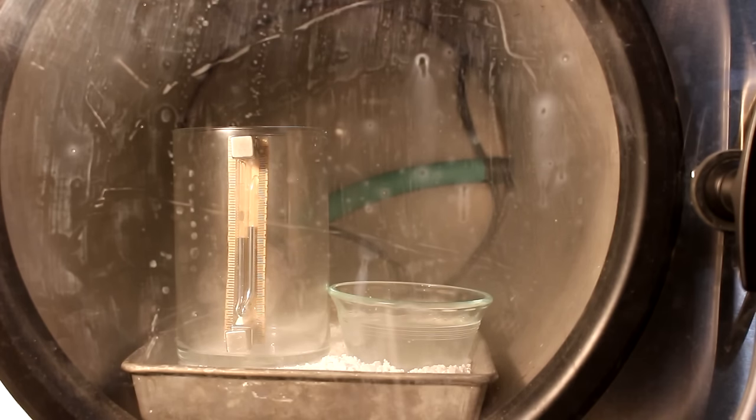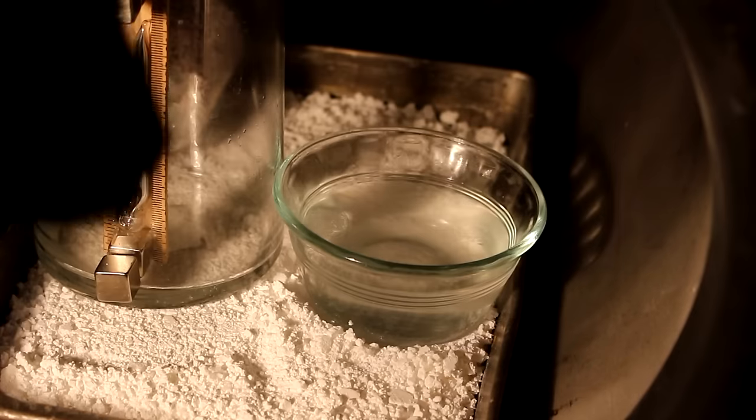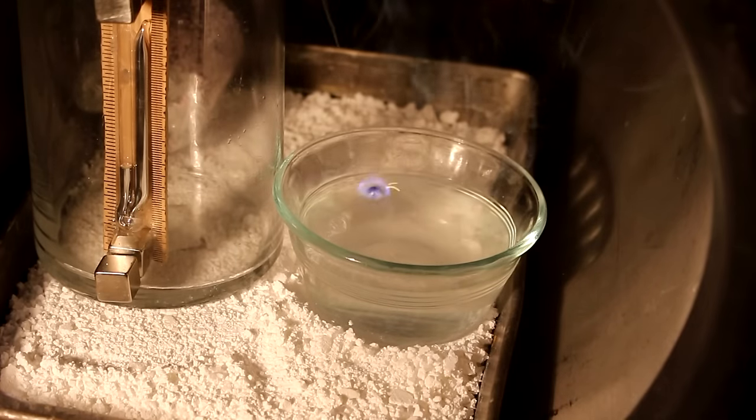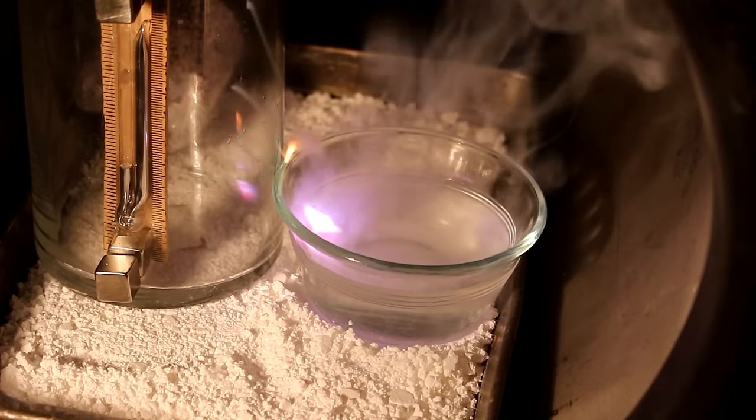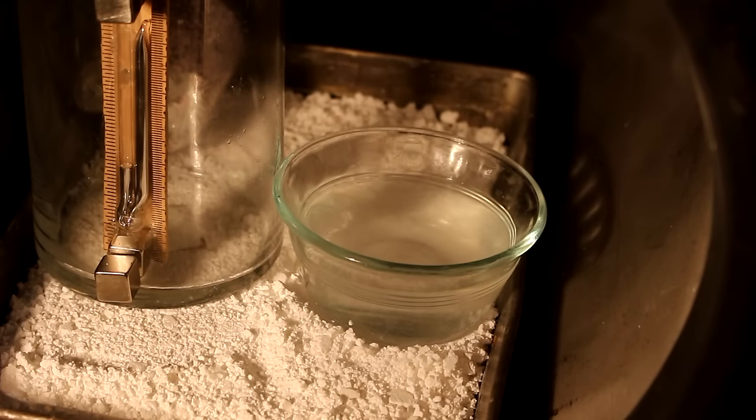Let's try it again from a different camera angle. I've repositioned the camera. Let's try this once again at atmospheric pressure. Looks rather spectacular, don't it? And it pops. Alright.